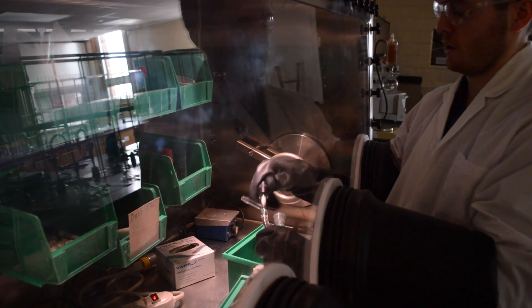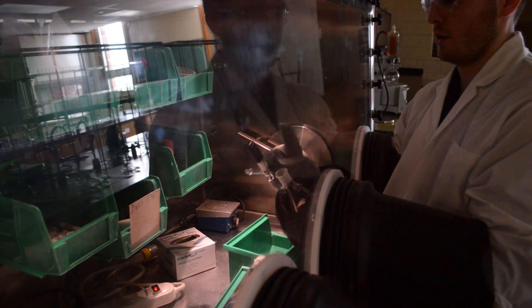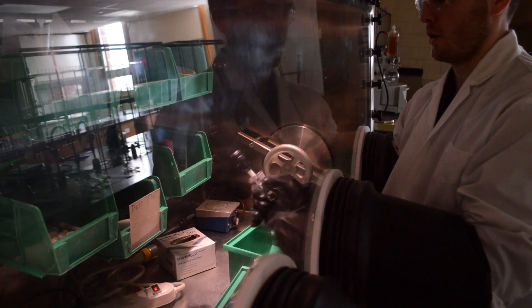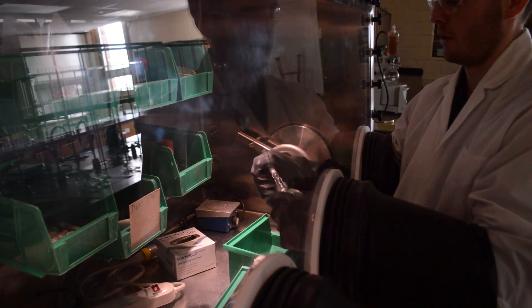Next, you can screw this top on. What this can do is actually seal the vessel from any outside air. Once we hook up tubes to this, we can set it on a vacuum line that we'll be talking about later on.